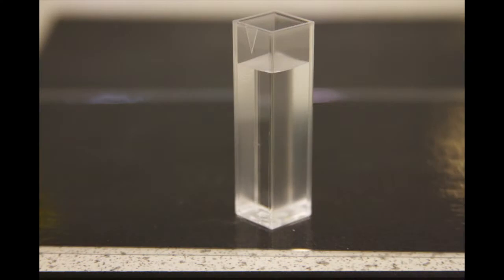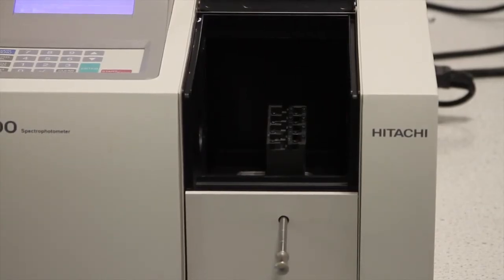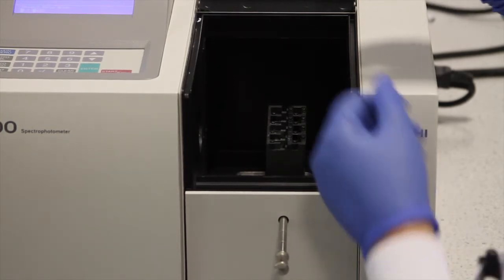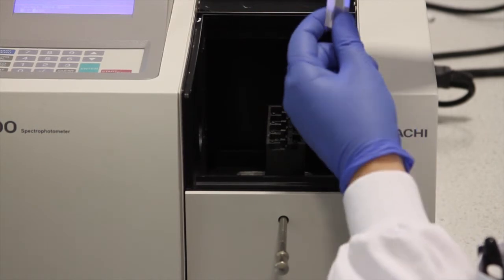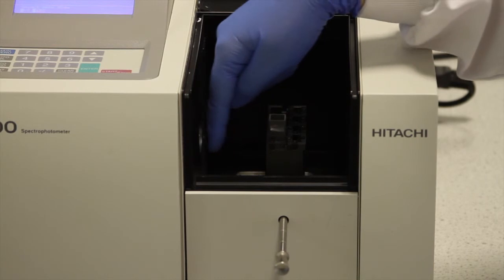Before taking a measurement of a sample solution, you should always take a blank measurement using a solution of 0 concentration. The copper sulfate solutions were prepared in deionised water, so this cuvette containing only deionised water is the most suitable blank to use. The cuvette containing the deionised water should be placed into the first slot in the carriage, and you should ensure that the clear side faces the slit in the side where the light beam will emerge.